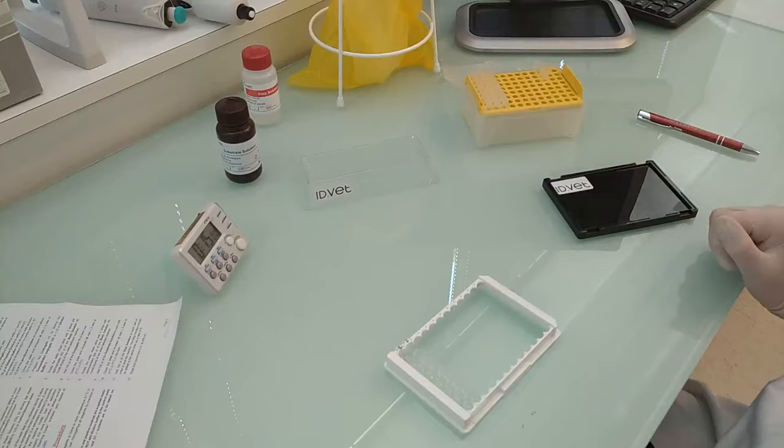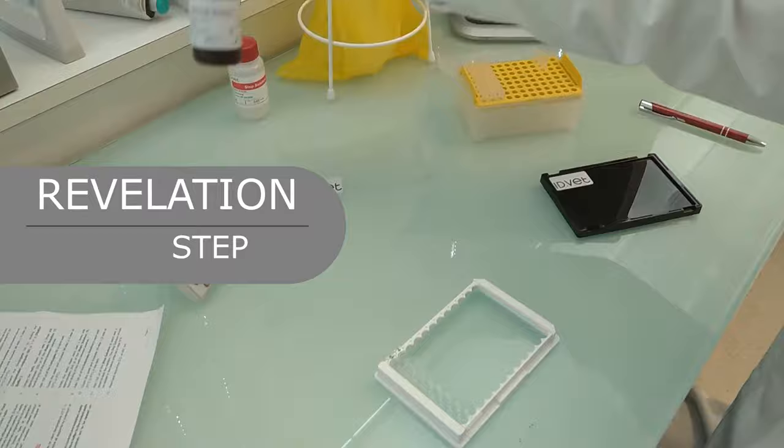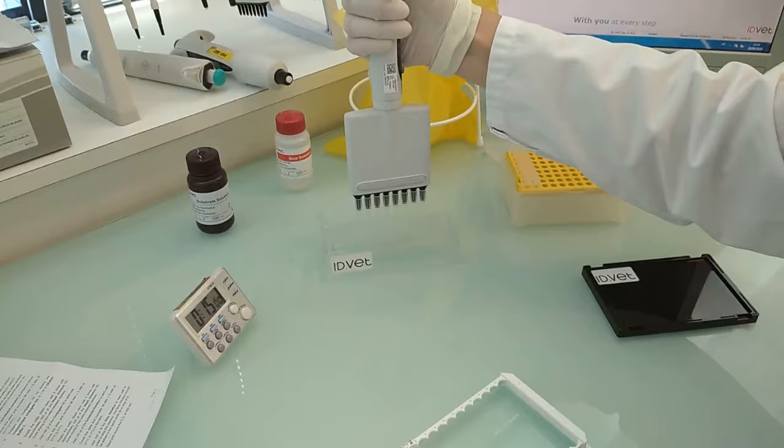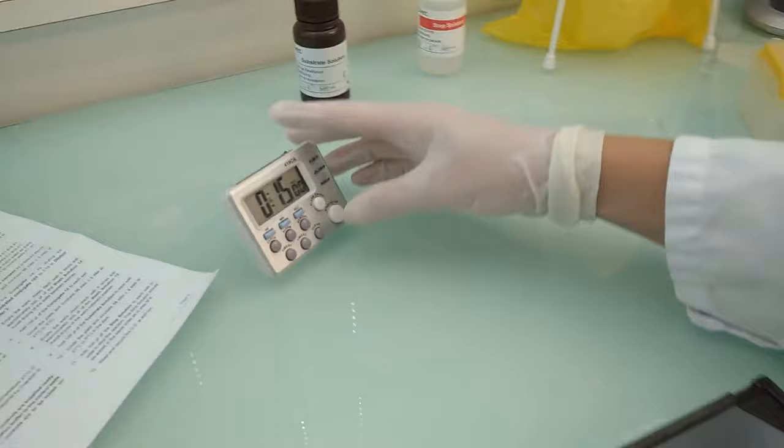Revelation step: The substrate is a light-sensitive solution. Add 100 microliters of the substrate solution to each well. Cover the plate and incubate 15 minutes at 21 degrees in the dark.